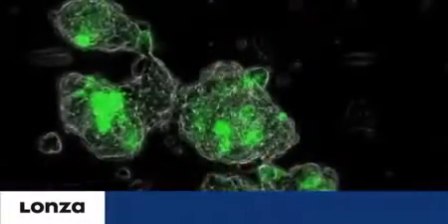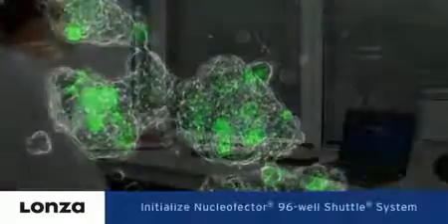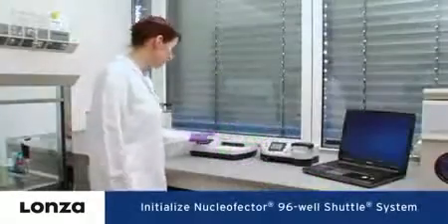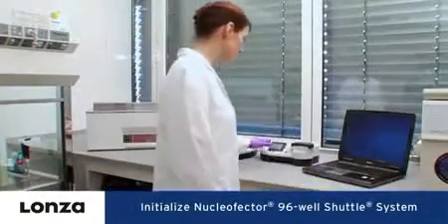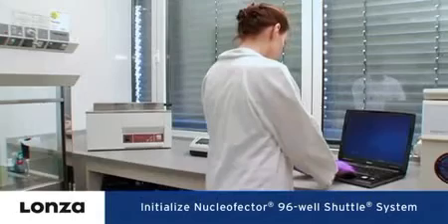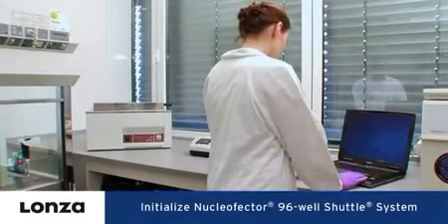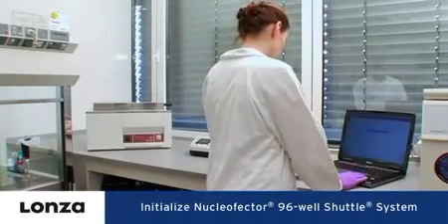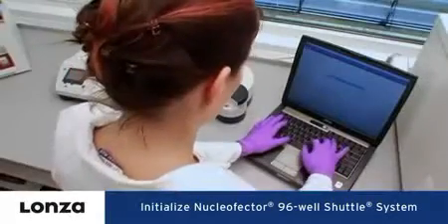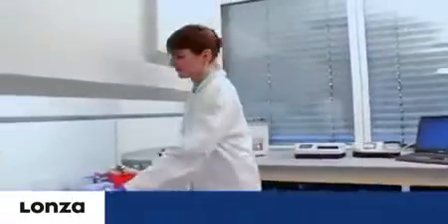Nucleofection on the 96-Well Shuttle. The first step is to power up the Nucleofector and the 96-Well Shuttle and to start the 96-Well Shuttle software. The software remotely controls the Nucleofector 2 and switches it to 96-Well mode.